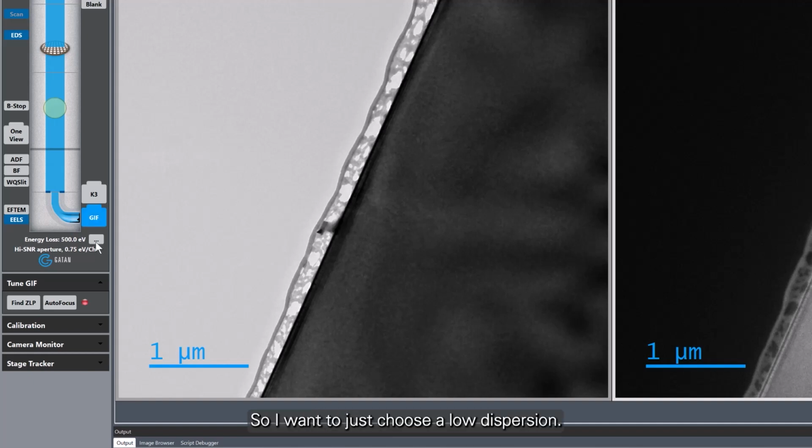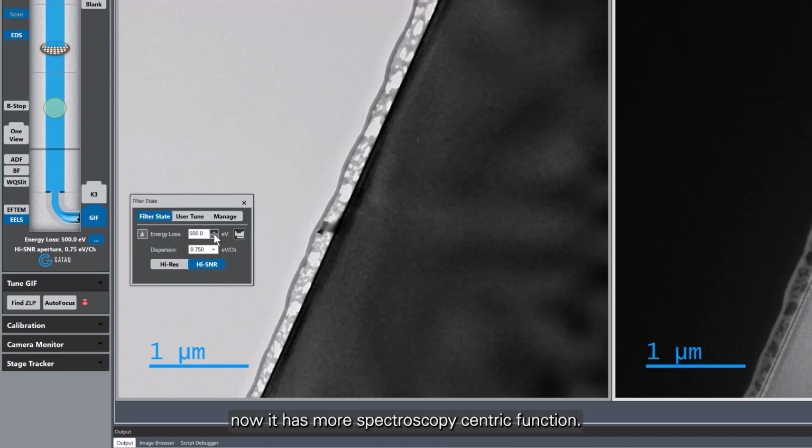I want to just choose a low dispersion. If I click on the same button that we used before to access the filter state dialog, now it has more spectroscopy centric functions. So I'm going to use the big aperture, which is 5mm round aperture, high SNR, and the lowest dispersion, which is 1.5 eV per channel. That gives us approximately 3000 eV energy range.